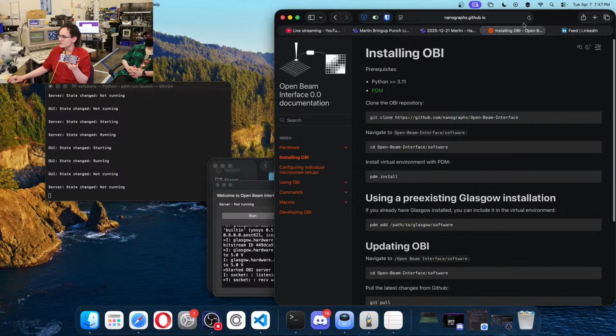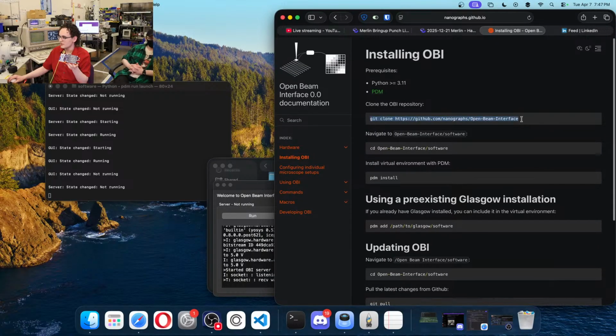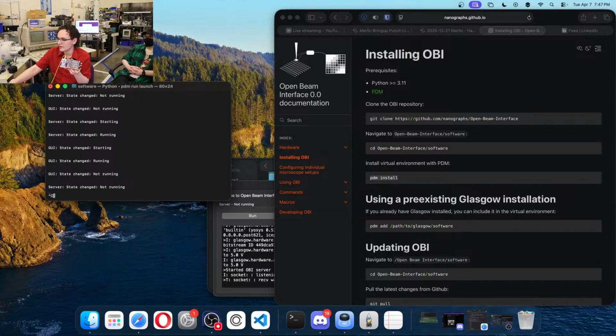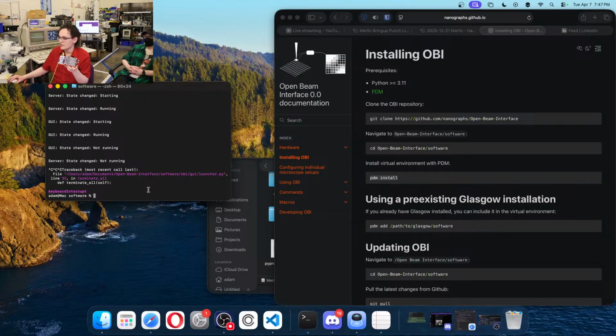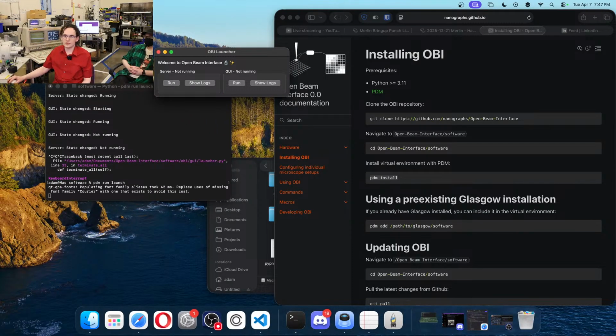And then all of the installation instructions are on the Open Beam Interface documents page. So all we did was the git clone. We went into the software folder, and then we ran pdm install, and that took care of us. After we ran pdm install, let me just close this so I can show you that again, we ran pdm run launch. And that is what brought up this GUI that we can run the server and GUI from.